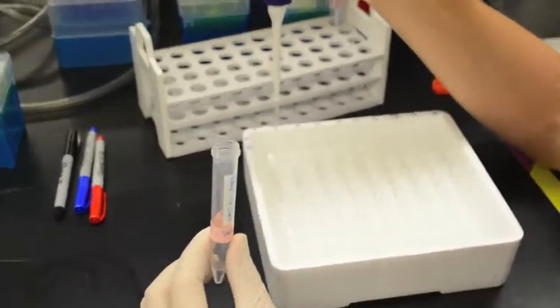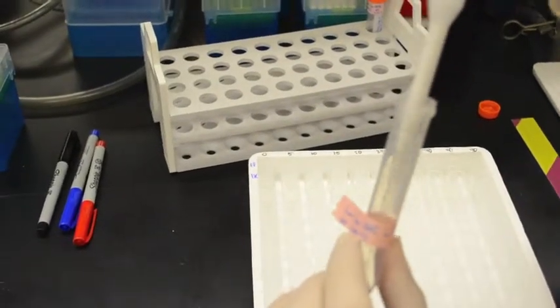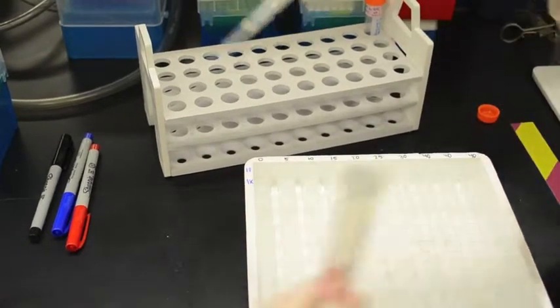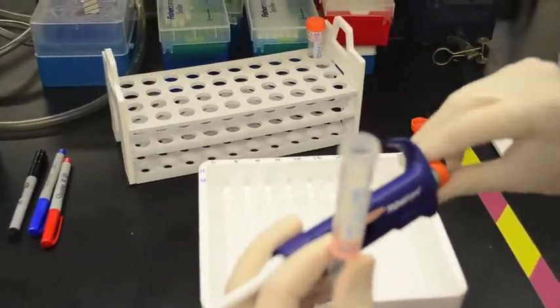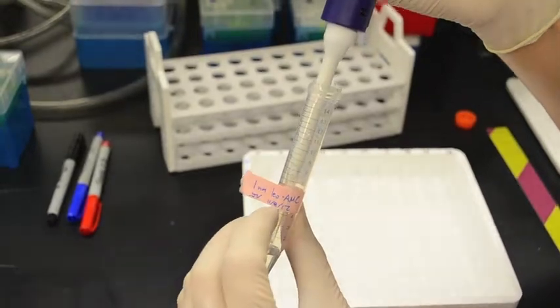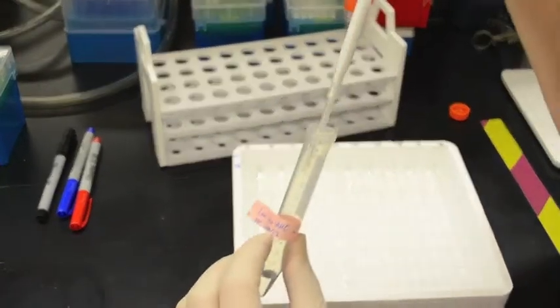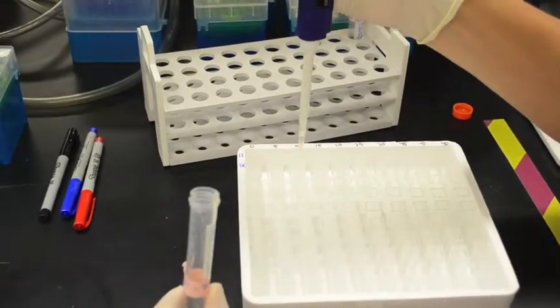but you want to get that 5 microliters out without touching the sides of the cuvette, because there's obviously a live sample in there, and you don't want to get any of your live sample in your enzyme stock, or your substrate stock, or else all of the enzyme substrate will get hydrolyzed and it won't work anymore.